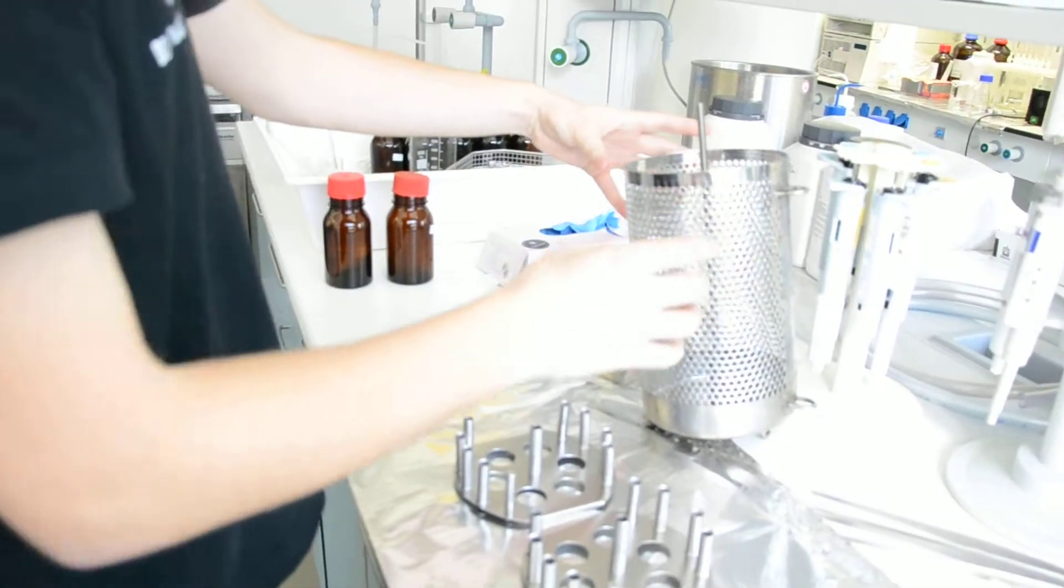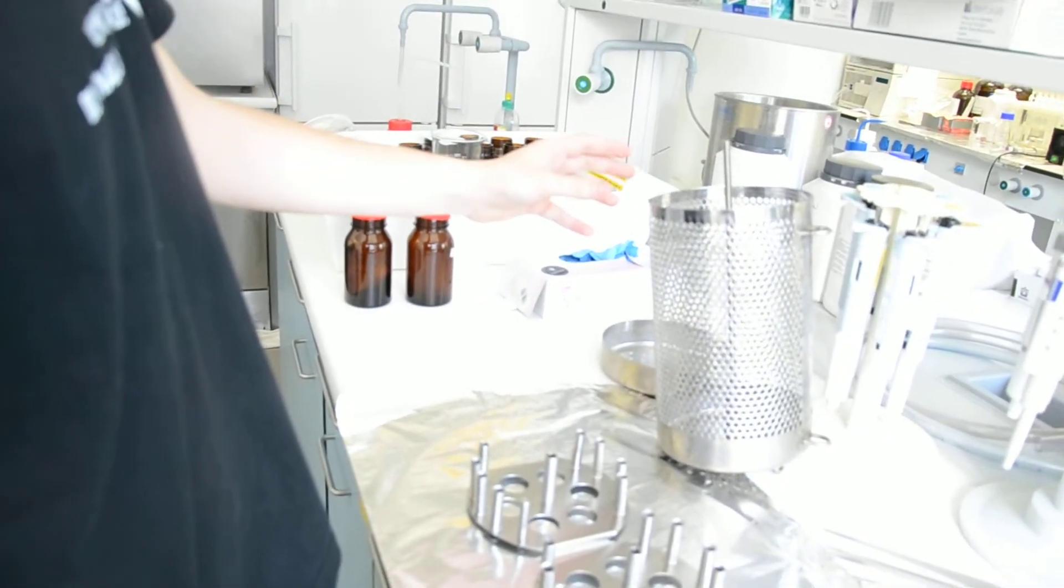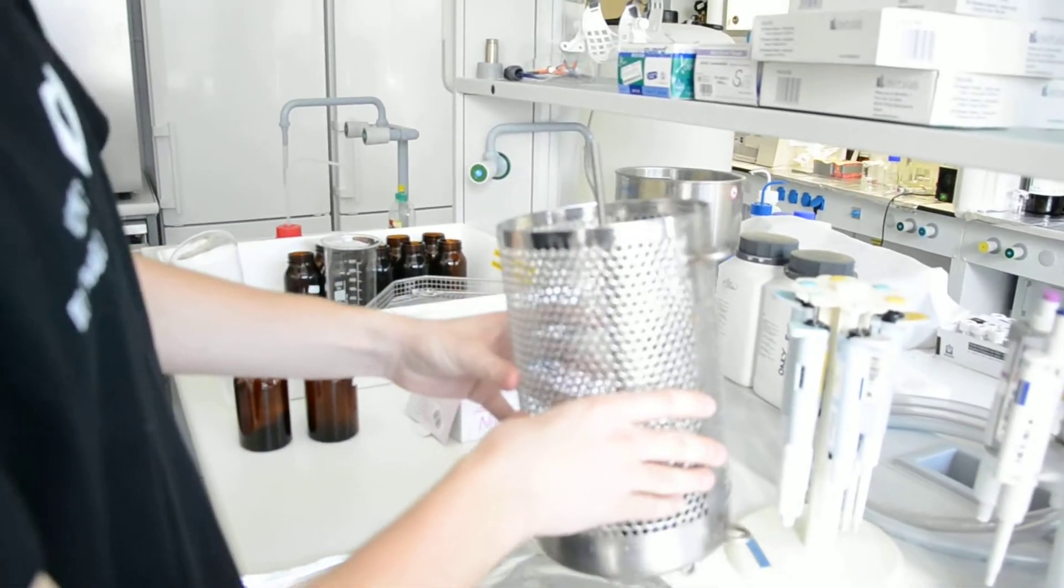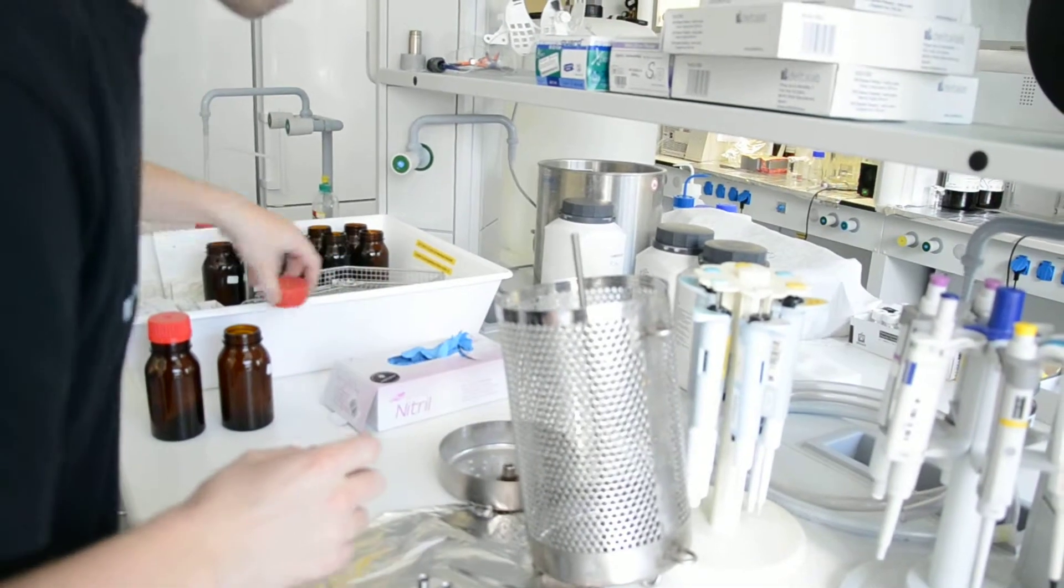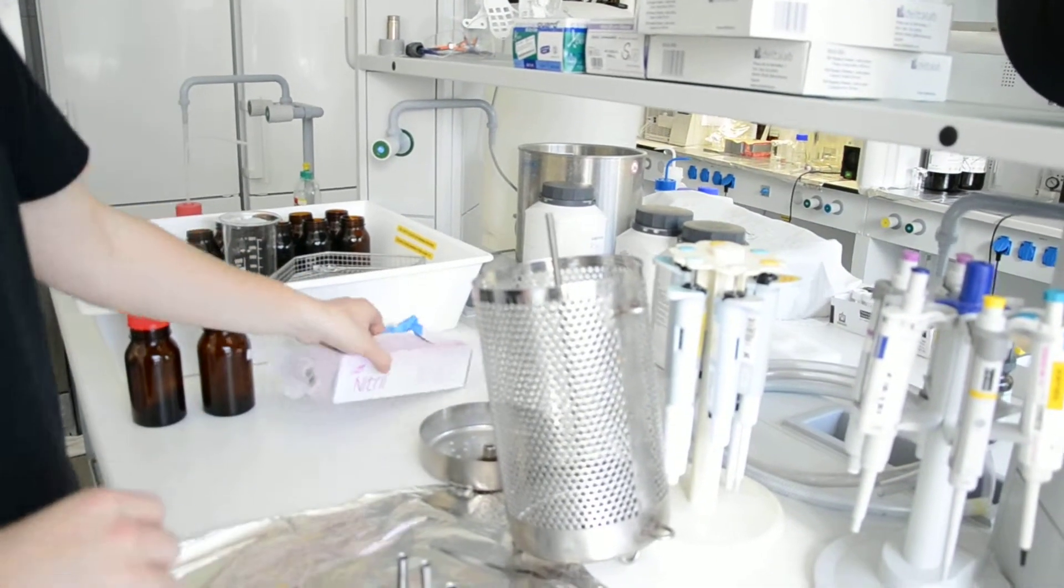First thing they have to fix this to the mooring. Before doing this you need to fix this cage to the mooring. Now we will take gloves.